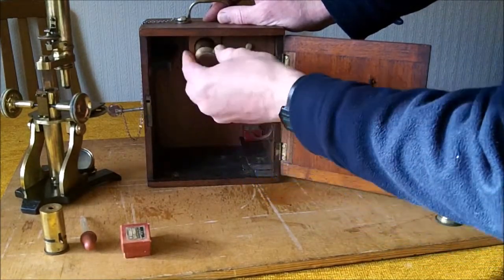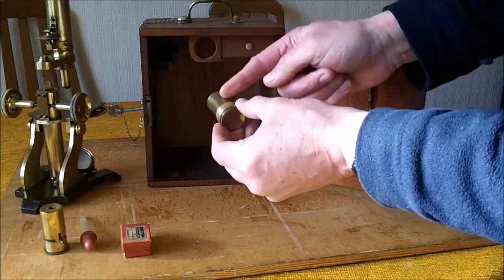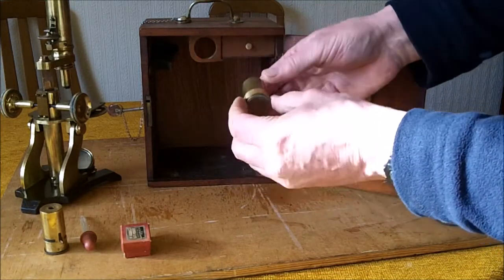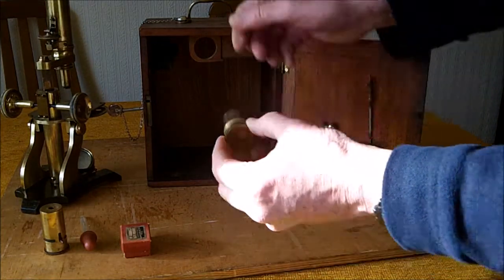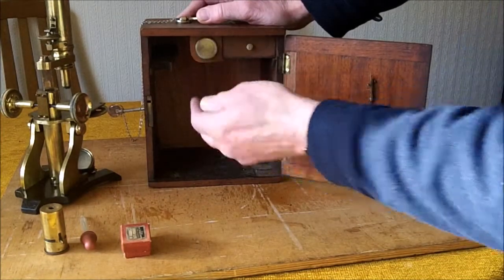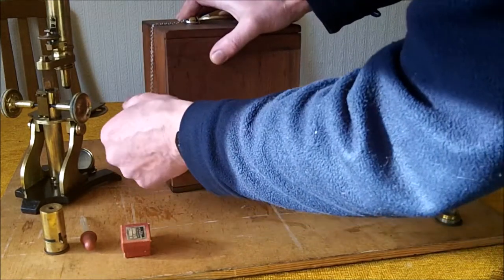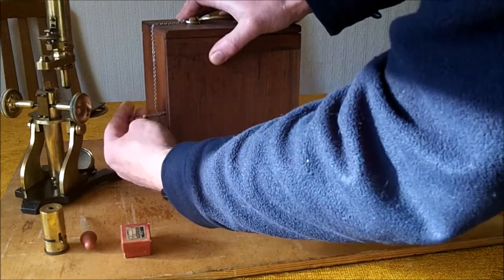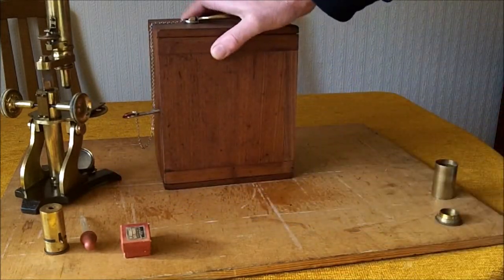This lens case — somehow the hole for this in here was far too large, so I put a brass collar on that so that it now fits in there. And I've also made a new key to lock the case.